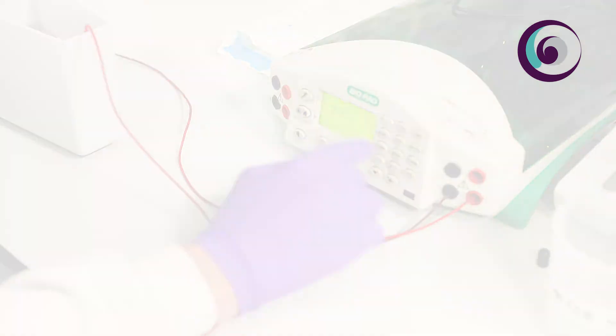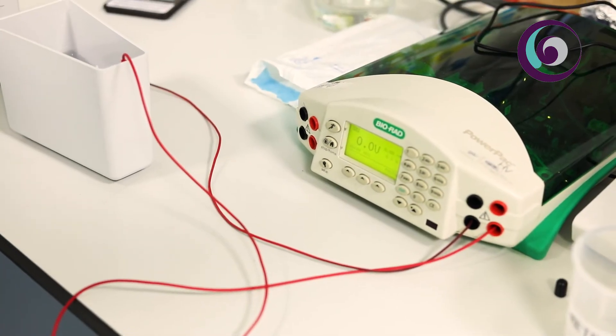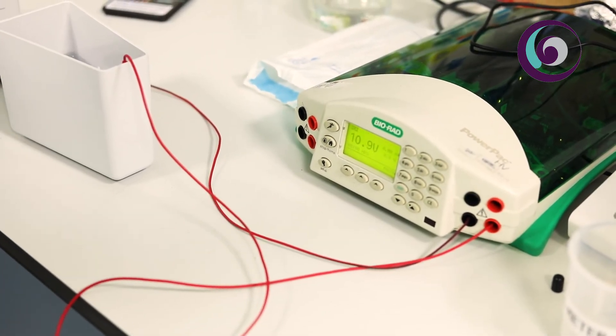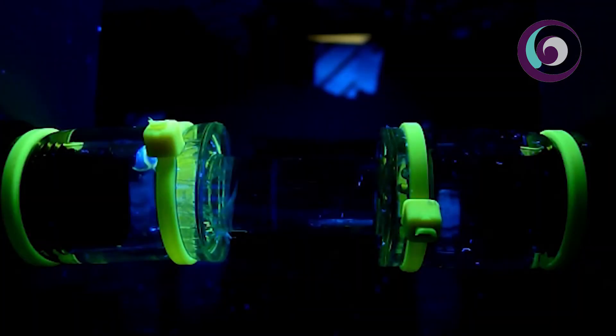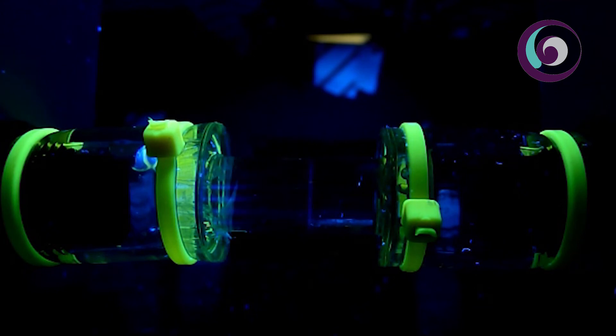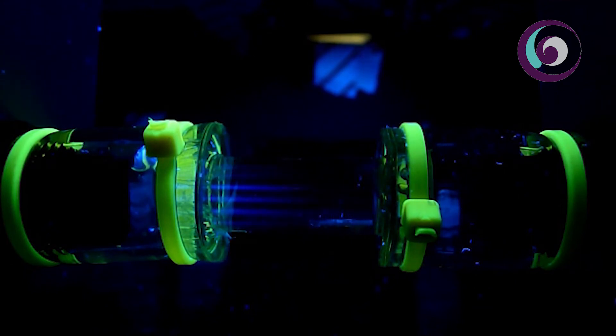The running current will be changing so that will tell us that something is happening but we are not able to see it yet and that's because we are just pre-concentrating the protein towards the mask. Once all the protein is there then the proper pattern will start taking place. In this case after 15 minutes we will start seeing a proper patterning of our proteins into this gel.